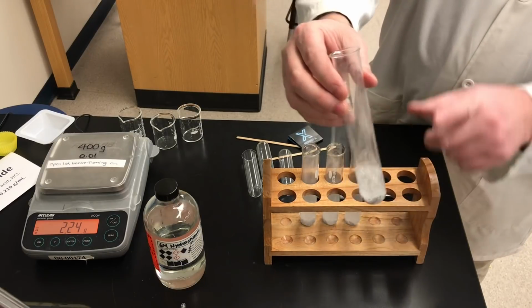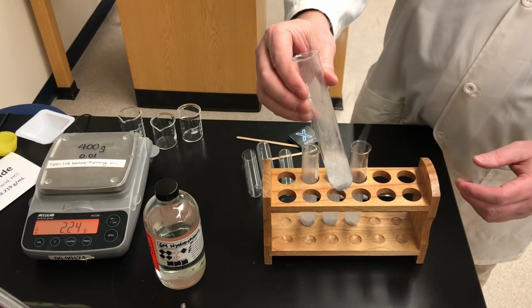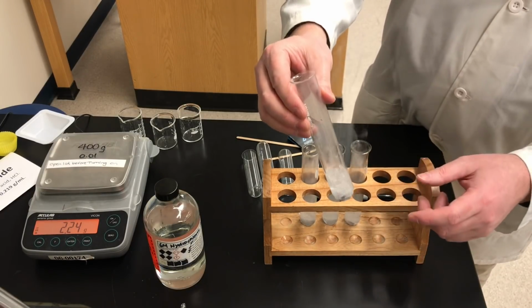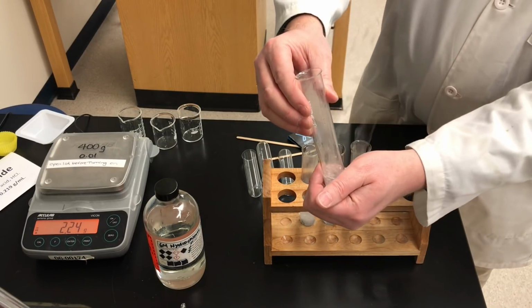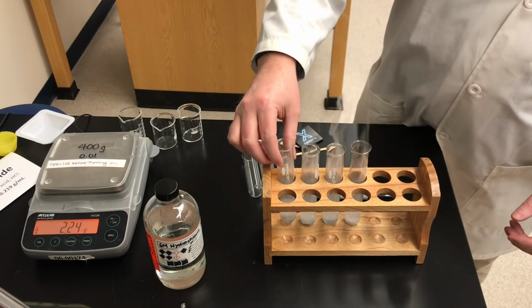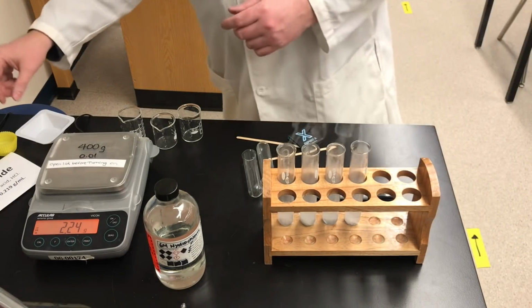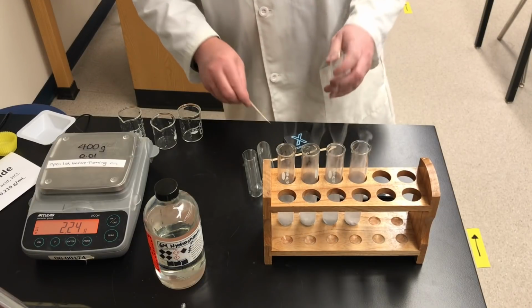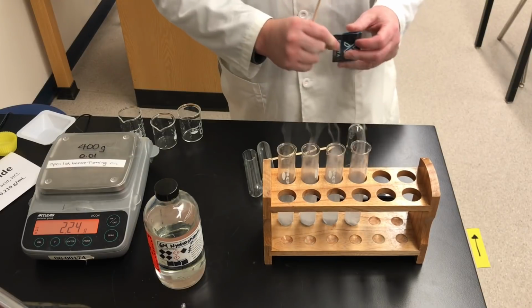A grade 11 student, you know what gas is being produced because you've already classified the chemical reaction. Grade 9 science, we don't really need to know the identity of the gas, but we're going to check it in just a moment. The test tubes are getting quite hot. Okay, so there's two evidences of chemical reaction, bubbling gas, and clearly it's getting hot, so that means this must be what type of reaction. If it's producing heat, there's a certain word that you would use to describe that.